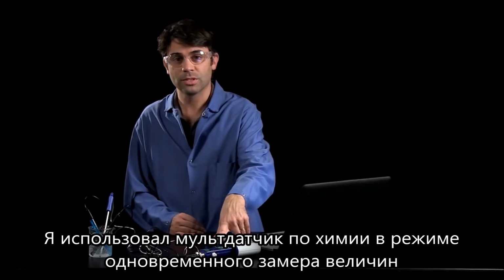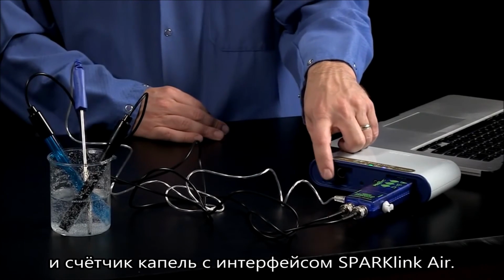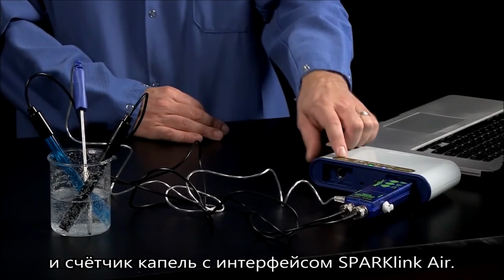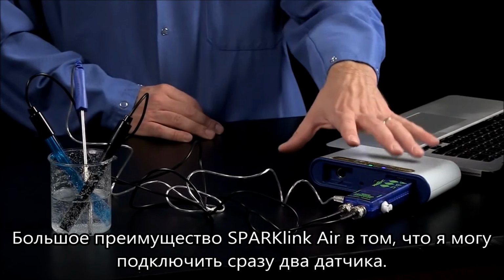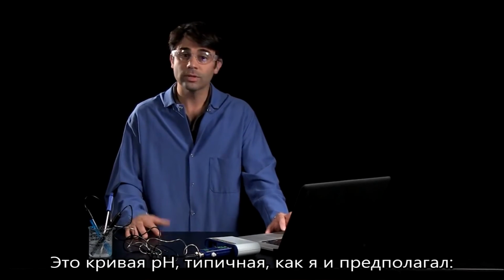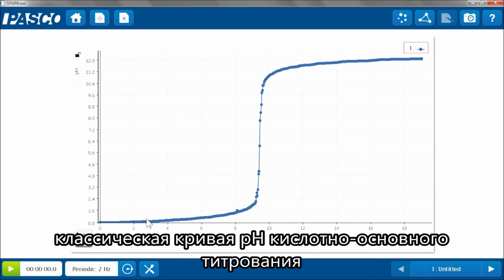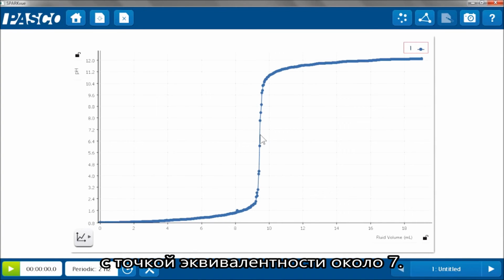And I used the Advanced Chemistry Sensor, so I can make simultaneous measurements. And I used a drop counter in the other port of the SPARKlink Air. The advantage of the SPARKlink Air is it allowed me to use both of those sensors at the same time. So here's the pH curve, typical of what you would expect. A very, very classic pH curve for a strong acid-base titration, with our equivalence point somewhere around 7.